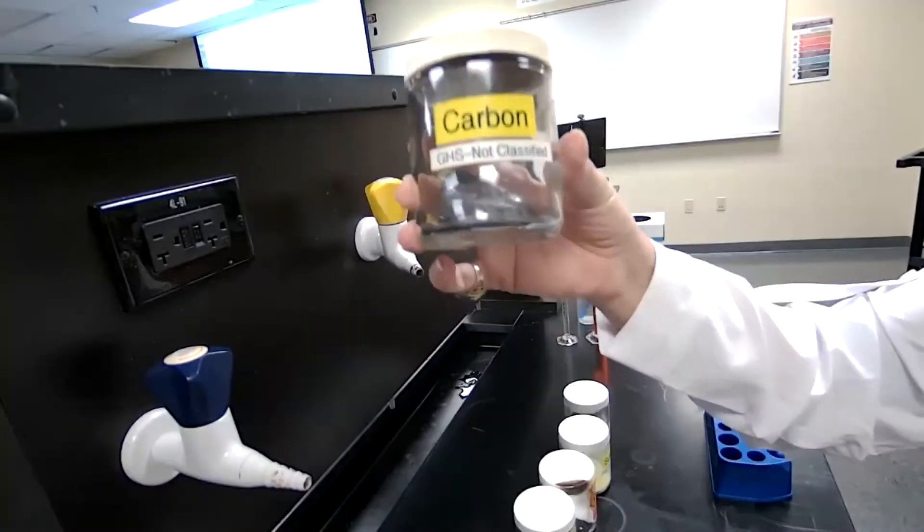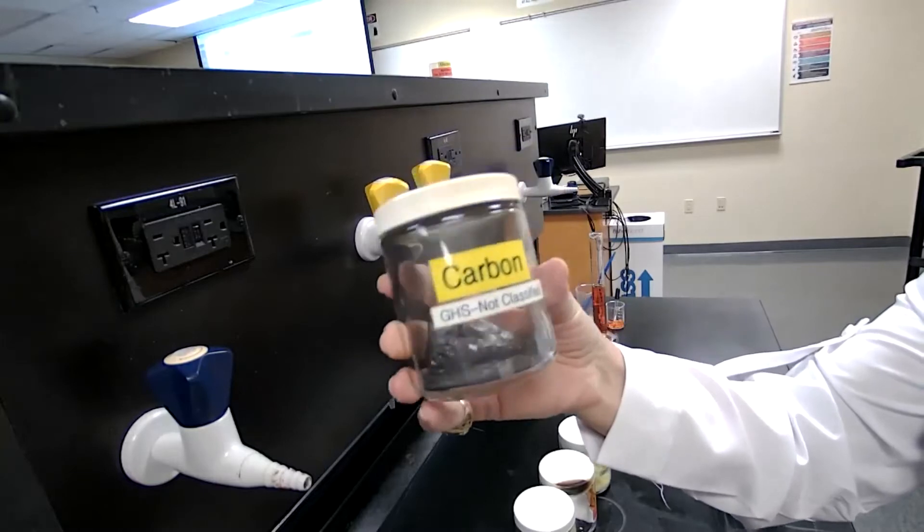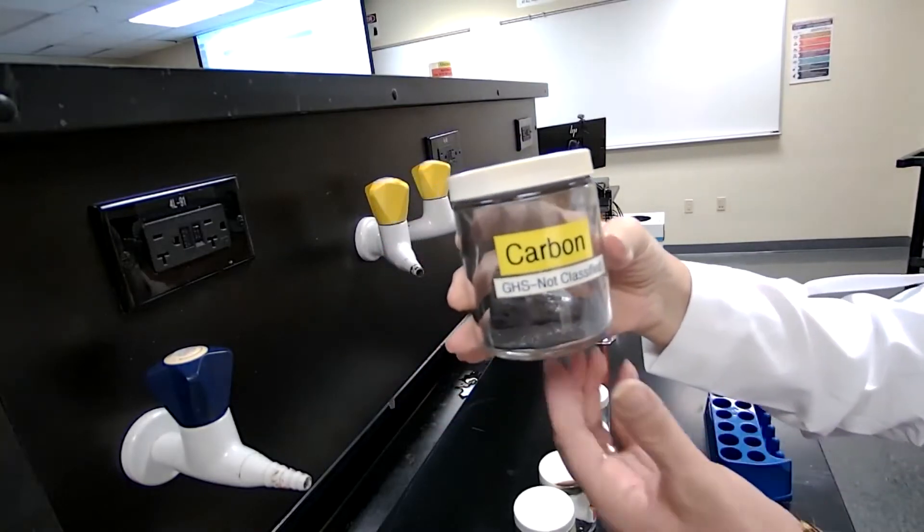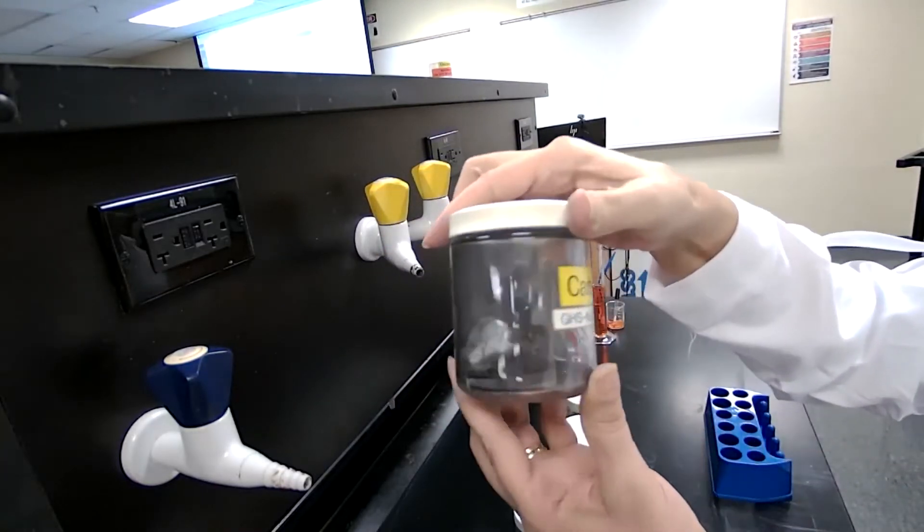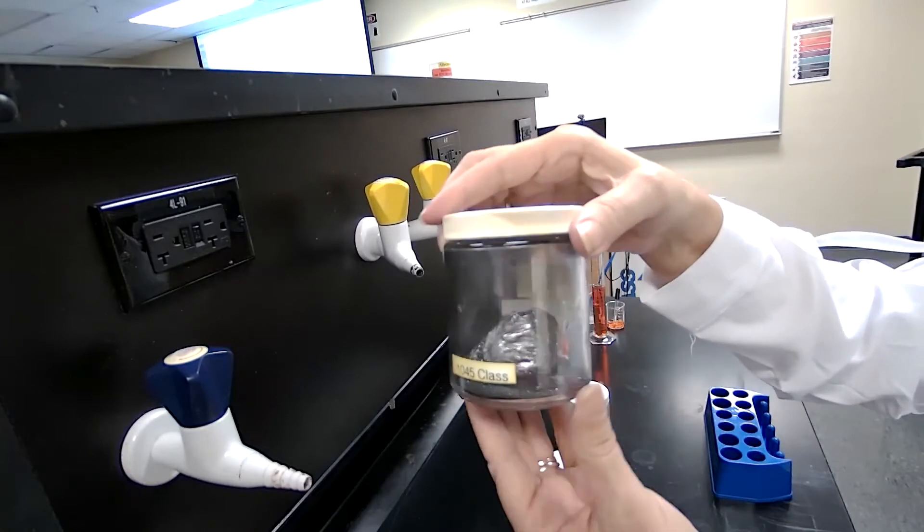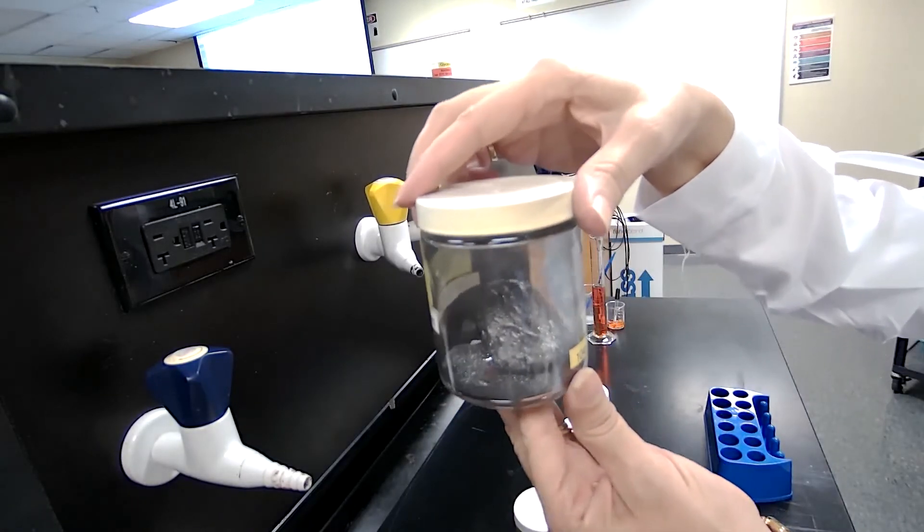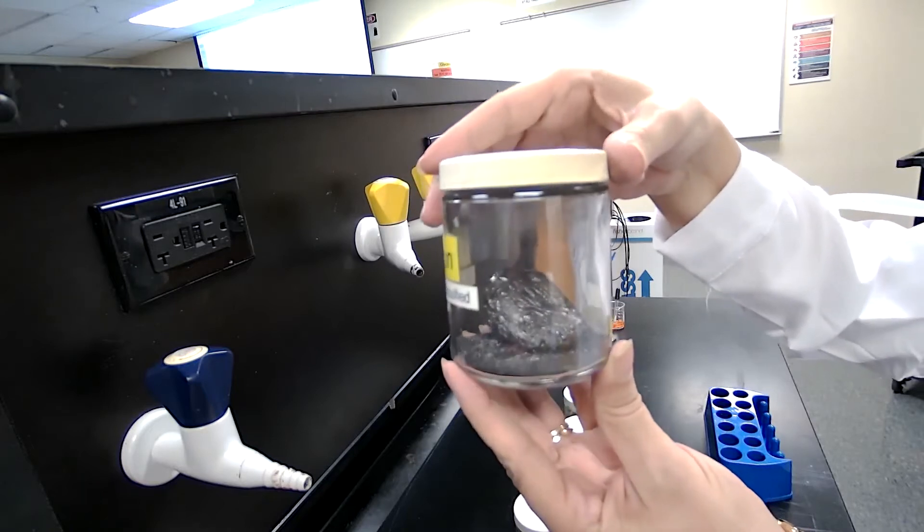I am Dr. Ramari. I'm going to help you with experiment two demonstration. Part one of experiment two, we have some elements in a closed jar and I'm holding them for you to record your observation.